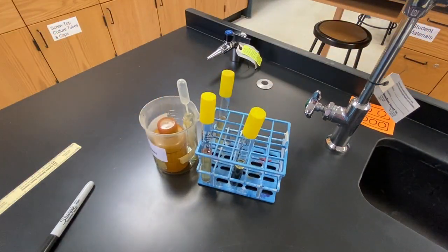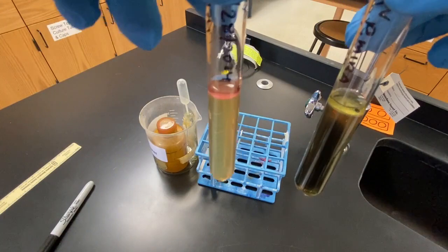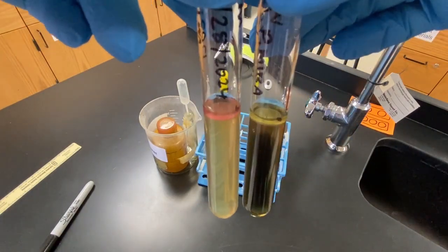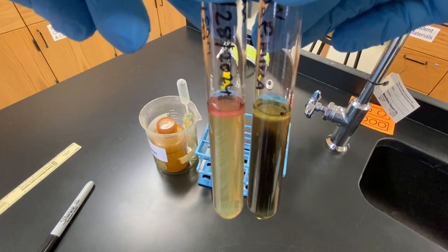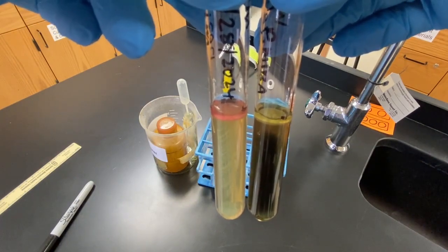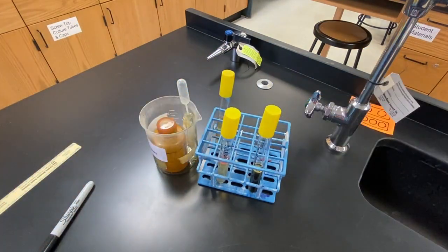The indole reaction can happen quickly, but it is common practice to wait up to 5 minutes to conclusively determine the result. A positive result is a pink or red coloration in the reagent layer. A negative result is the lack of a pink or red color, with no color change from the original color.